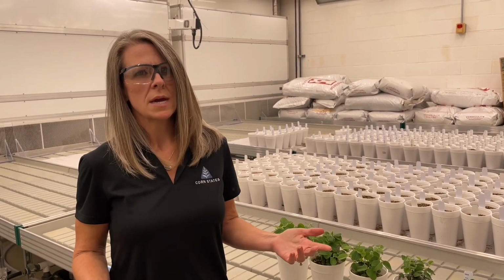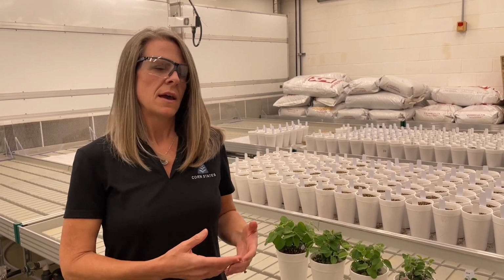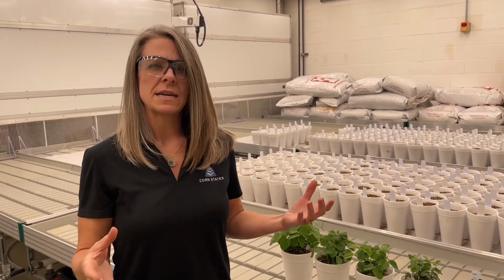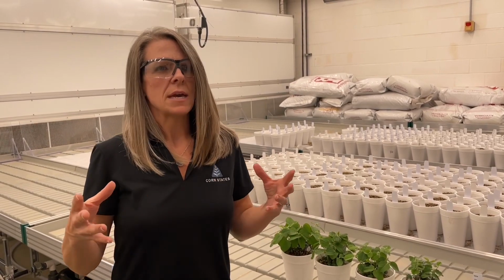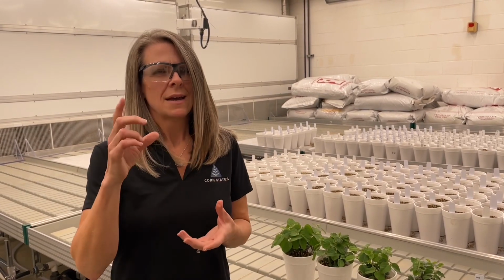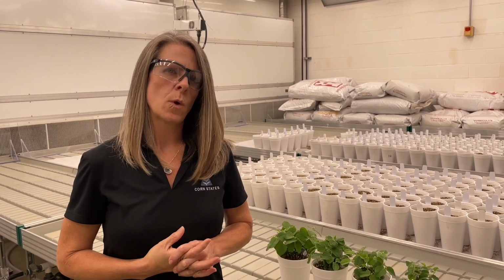But when it's time to rate them, we'll actually look at the amount of root rot that we see, and we will rate them on a 1 to 9 scale, 1 being 0 damage from the pathogen, and 9 being completely rotted roots and very little seedling. A lot of times we'll have seedling death in that case as well. So that look at our field tolerance assay just gives you a picture of one of the ways that we can really protect our crops in the field.